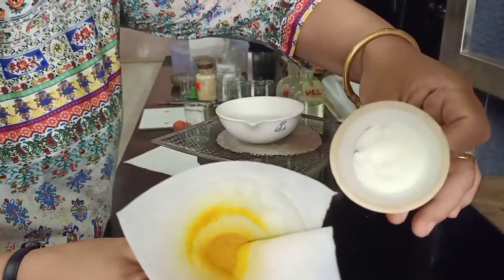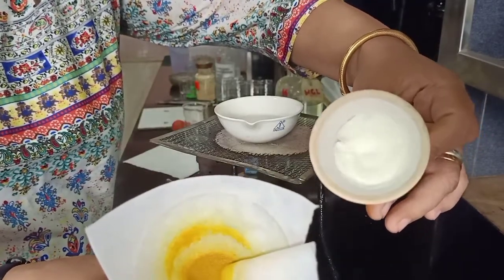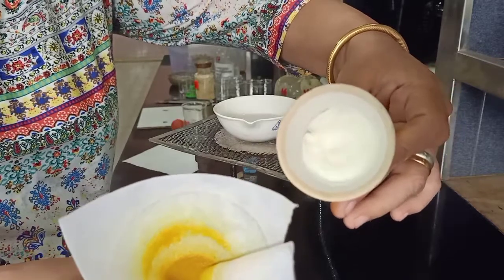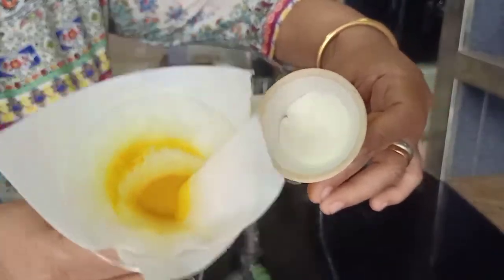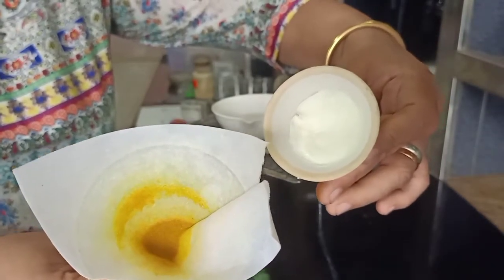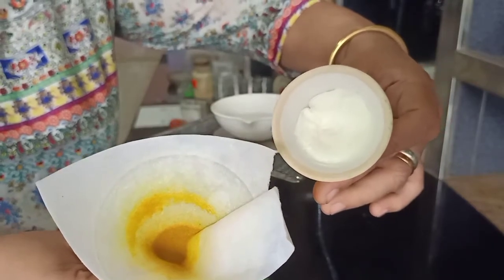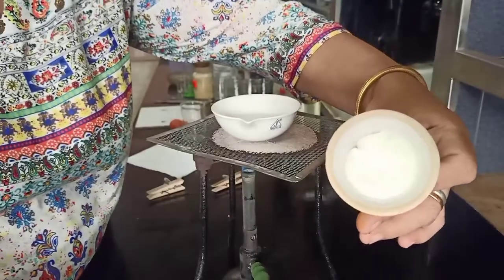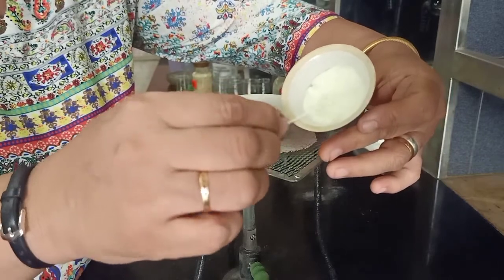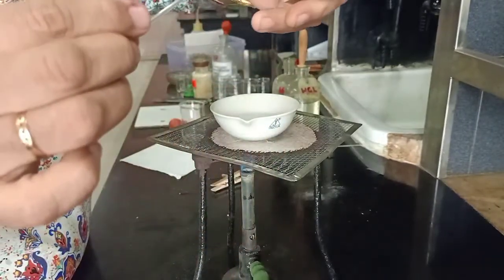We have now got our two components — component A, which is the water-insoluble acid, and component B, which is our water-insoluble base. After recovering both components, the examiner or teacher will specify which of the two you need to identify. Before deciding the drying temperature, we need to ensure whether our compound is high-melting or low-melting. Take a very little of the compound — remember yields matter, so we cannot take too much — and transfer it to a fusion tube.